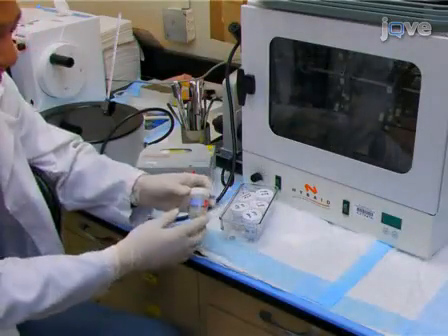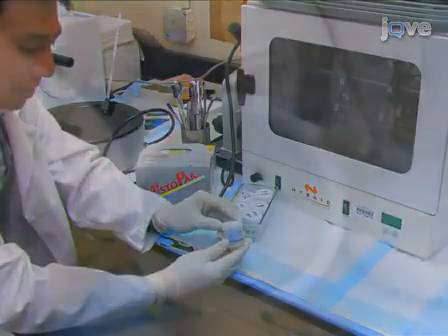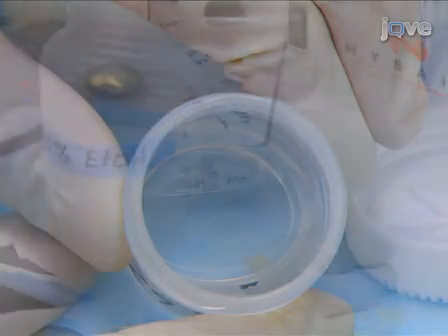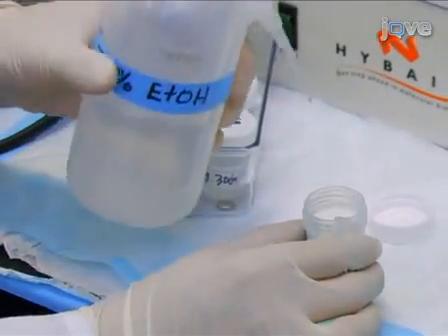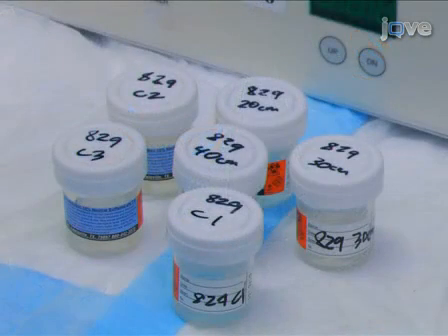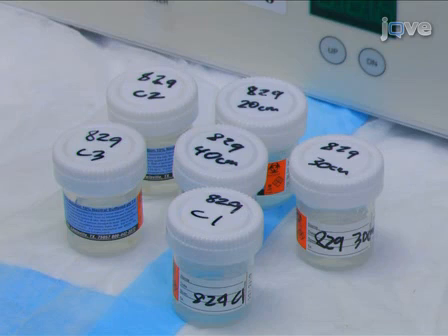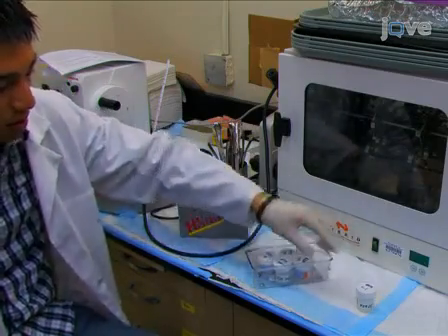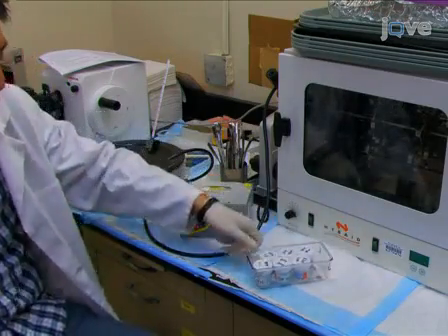Biopsies of normal colonic mucosal tissues are obtained from patients during a screening colonoscopy and placed in jars of formalin. After 4 hours, the formalin is replaced with 70% alcohol. Similar samples of tissue are obtained from areas of colon resections, 1 centimeter and 10 centimeters away from colon cancers or adenomas with advanced neoplasia. The tissue samples are sent to a histology laboratory for processing into paraffin blocks.